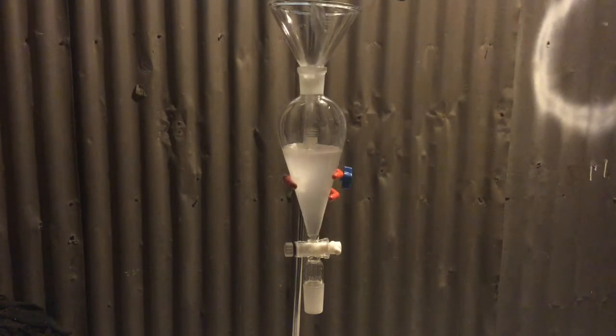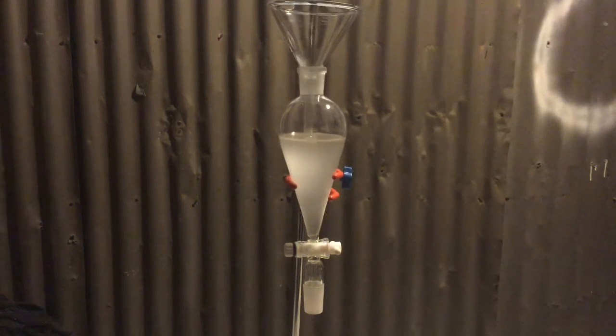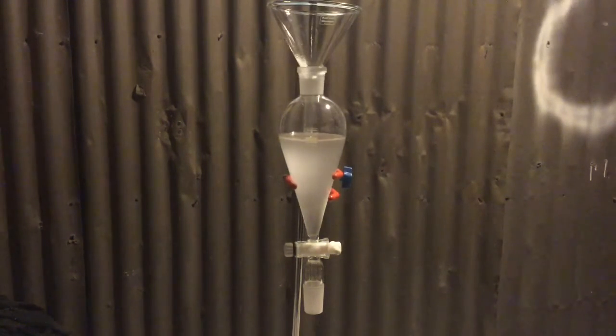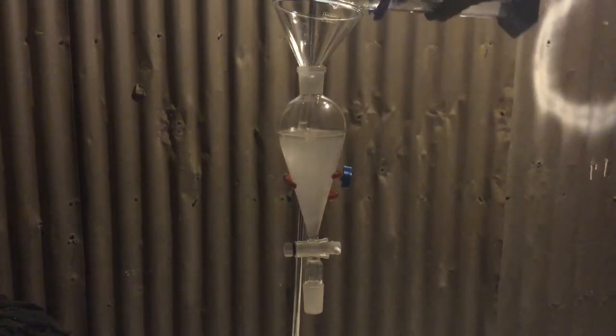Since DCM is immiscible with water it will form a separate layer, however methanol is miscible with water so therefore it will be extracted into the aqueous layer. Then 50ml of distilled water was added to the funnel.